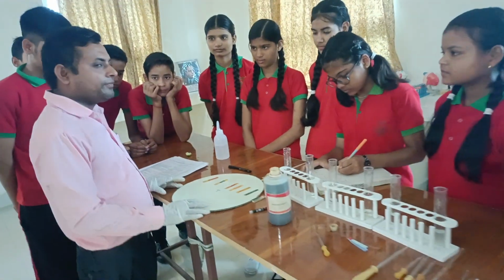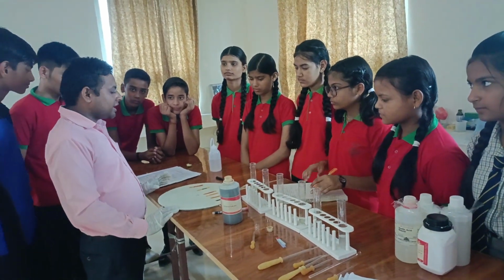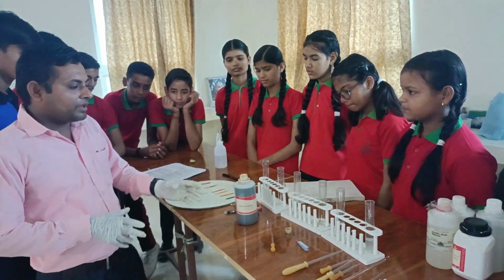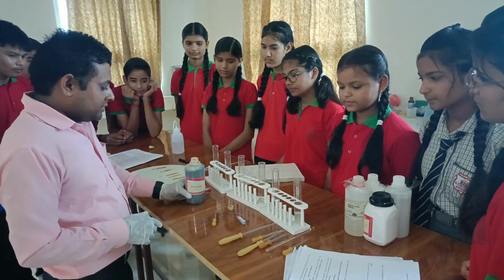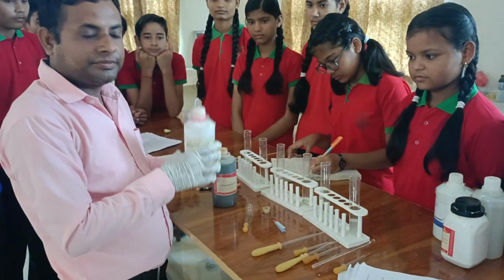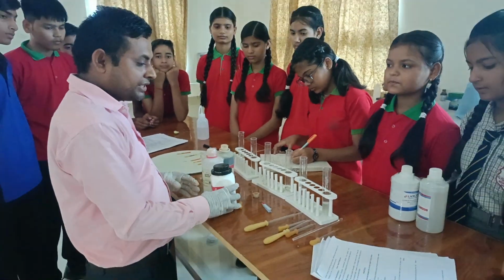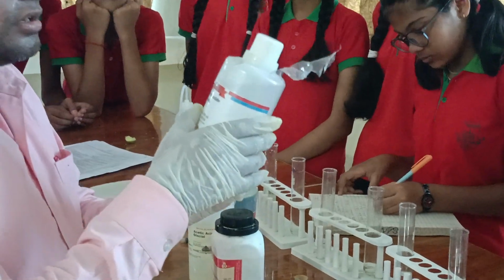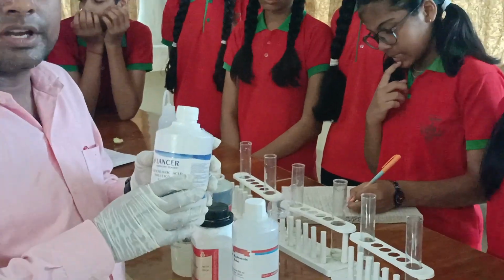Dear students, today I will perform the acidity and basicity test of solutions with the help of pH paper and indicator. Some materials are required for this activity, like universal indicator, acetic acid, dilute sodium bicarbonate solution, dilute sodium hydroxide solution and dilute hydrochloric acid.